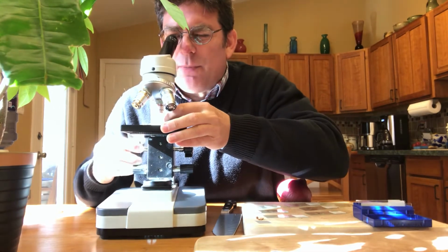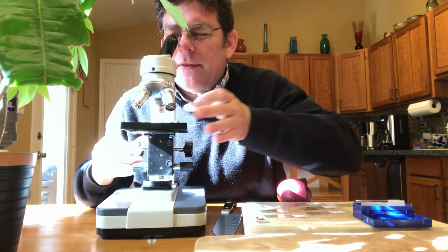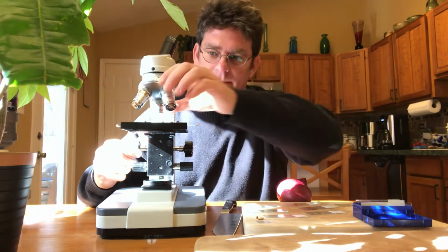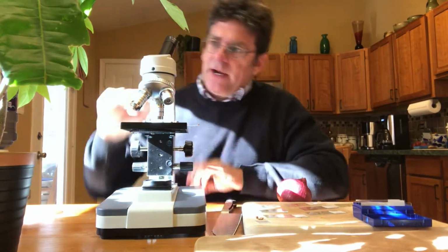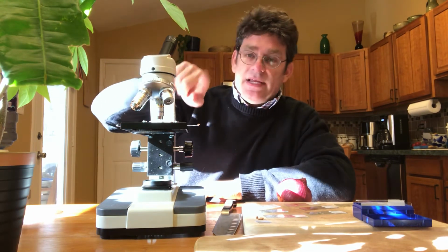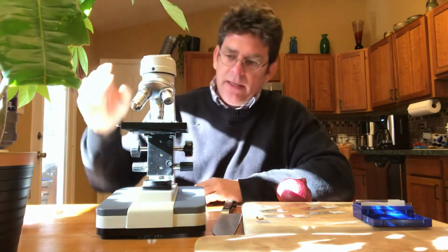All right, so what I do now is I've got my piece of leaf on there. If I did a good job pulling off a thin piece, I'll be able to see some cells. Oh, I can definitely see them there. They look like little green circles, and again, I'll try to photograph this if I can. Once I see it on low power, then I can spin this around and go to medium power. Now, medium power in this microscope has an eyepiece of 10, and medium power is 10. So 10 times 10 is 100. So now I'm looking at something 100 times bigger than it normally would be.